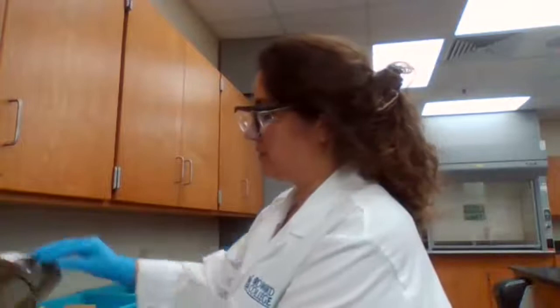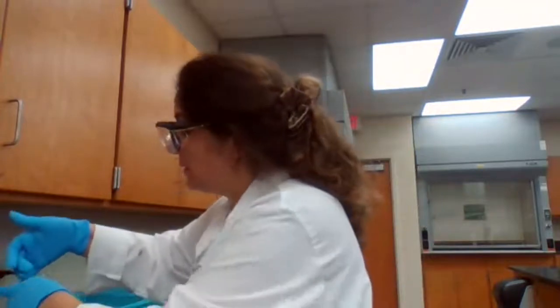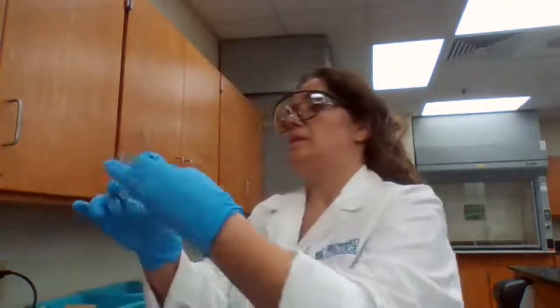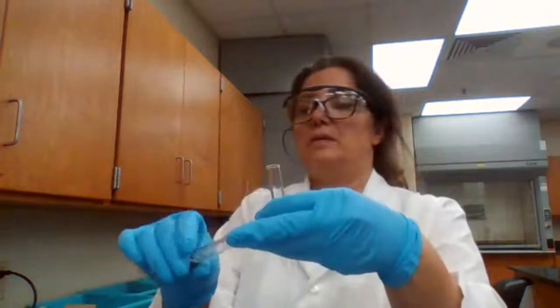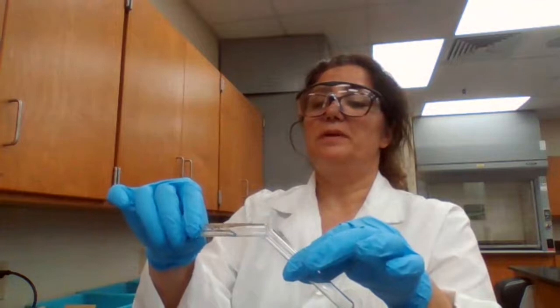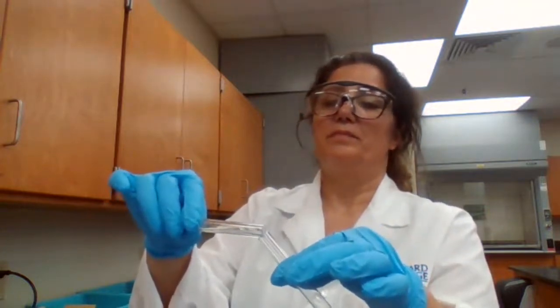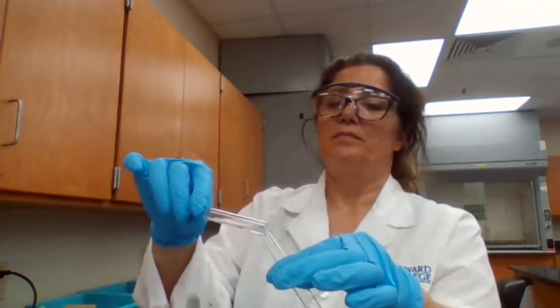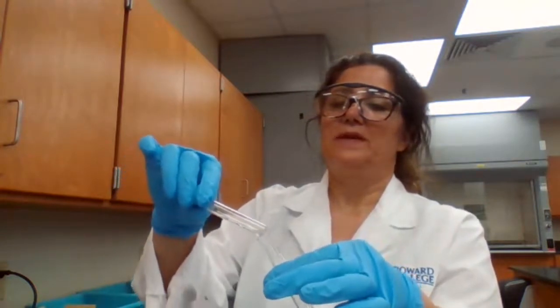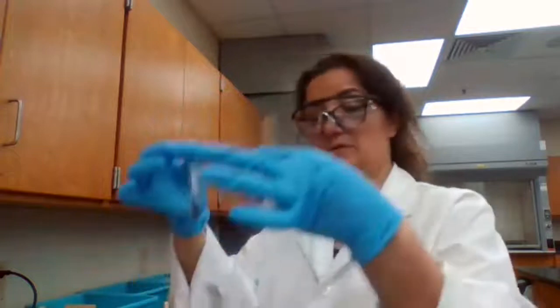Okay, wait for the centrifuge to stop before I take the test tubes out or open it. The liquid portion separated. It is telling me to keep the liquid for part B and the solid for part C. So I'm going to separate it.